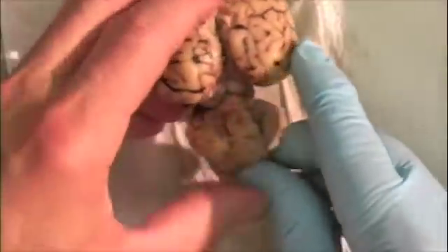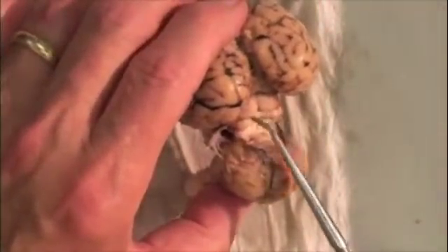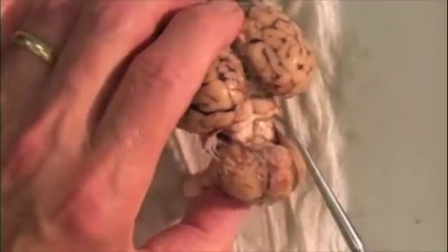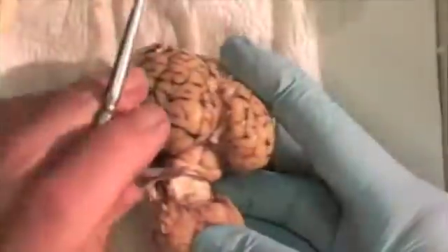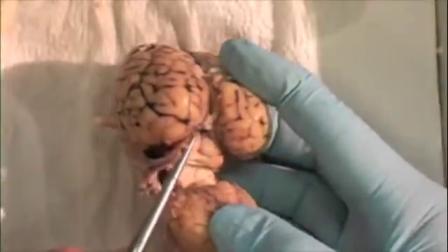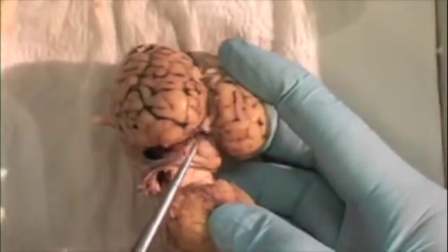If we bend the cerebellum downward, we see the corpora quadrigemina consisting of the superior and inferior colliculi. Just dorsal to the corpora quadrigemina is a medial structure, the pineal gland.